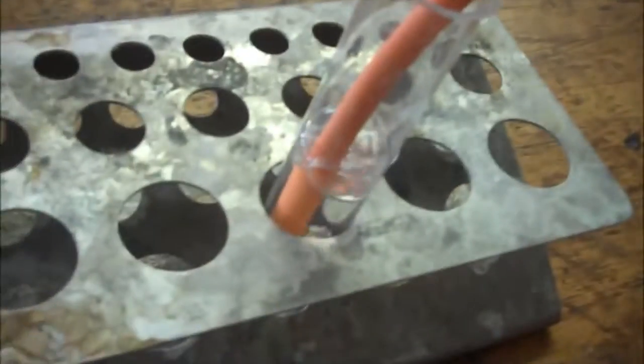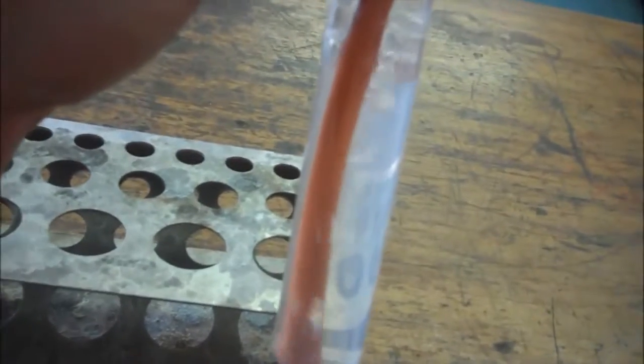Over here, you can see bubbling occurring. And slowly but surely, this lime water will change and go cloudy.